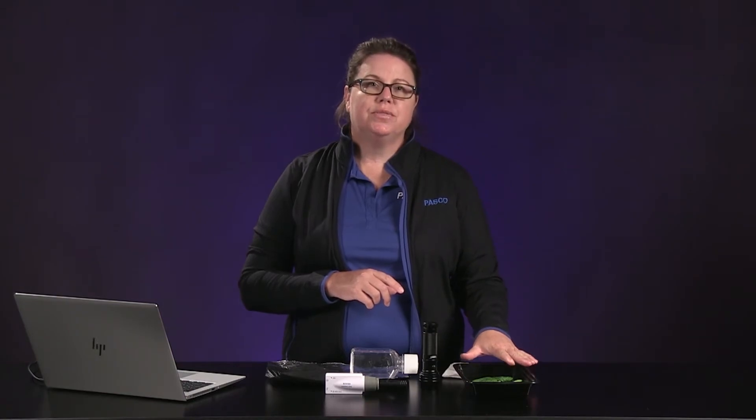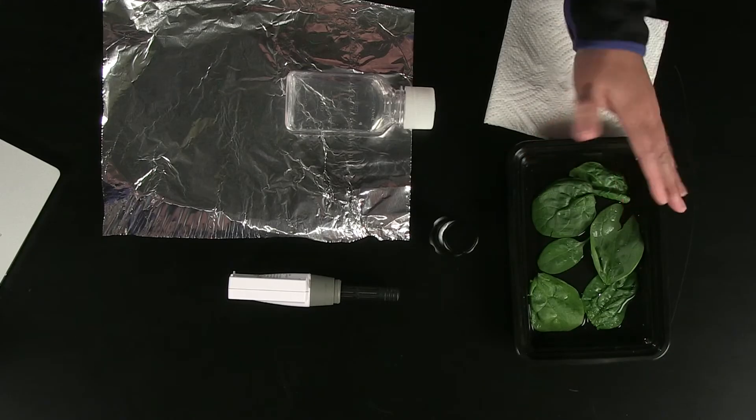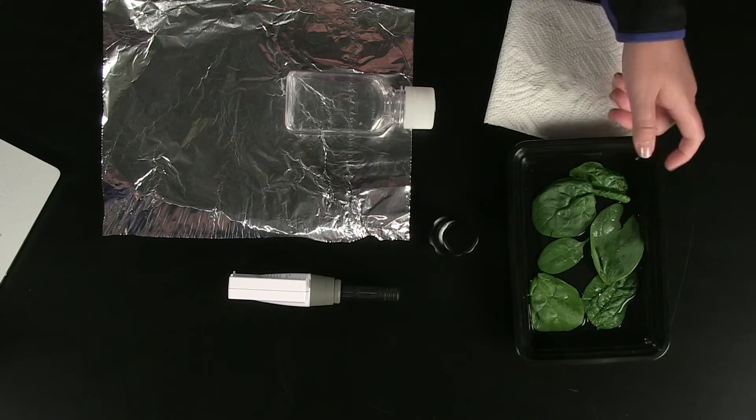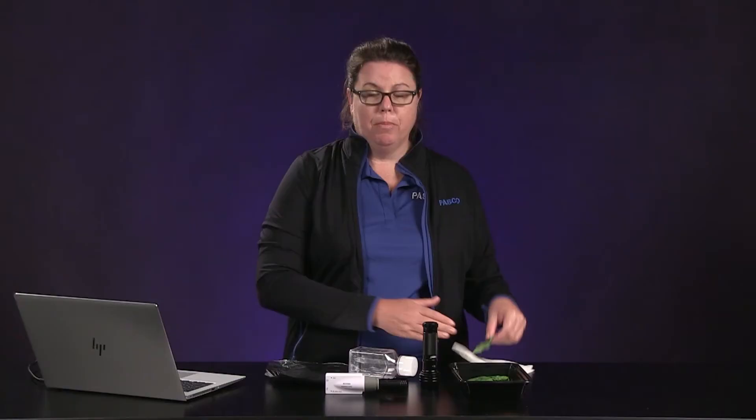To reduce the stress, float a single layer of spinach leaves face up in a shallow pan filled with water for about 20 minutes or so prior to your investigation. Then you'll want to blot them dry before you place them into the sample bottle.